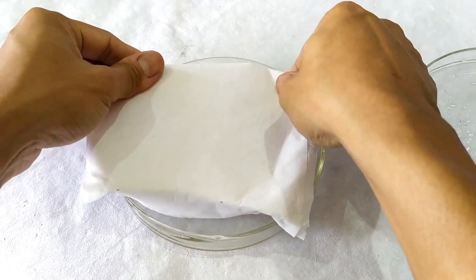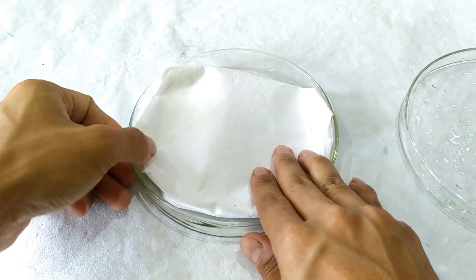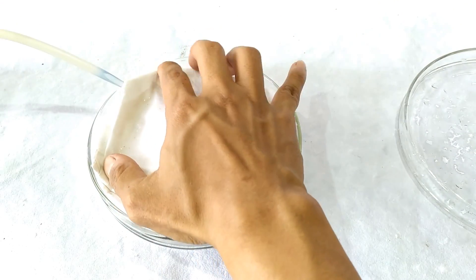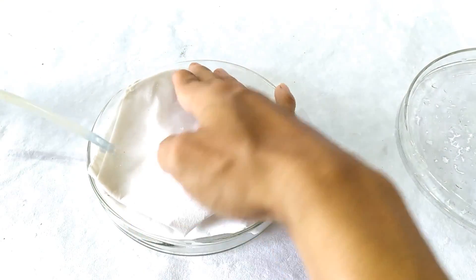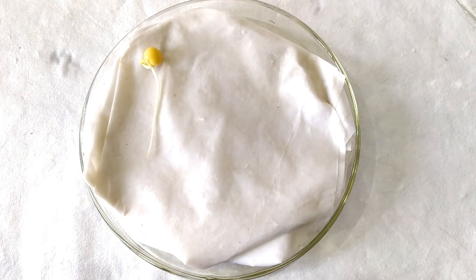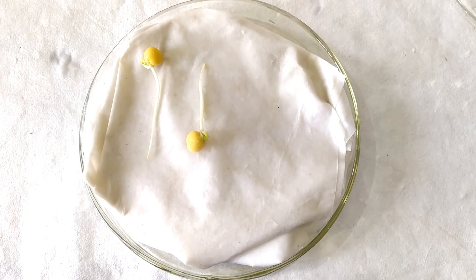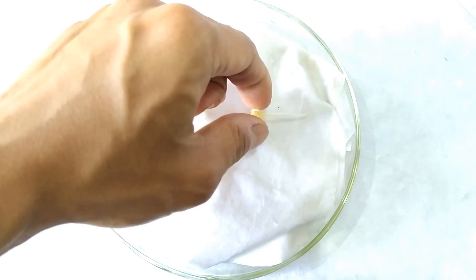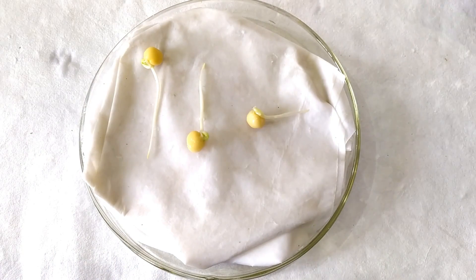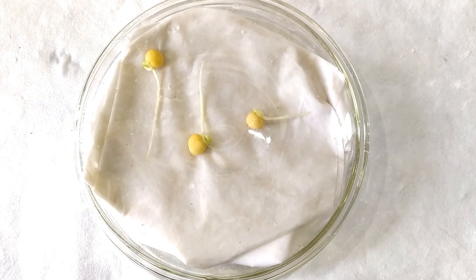Take the petri dish and line the bottom of the plate with filter paper pads. Wet the filter paper by adding some water. Take three germinating seeds with straight roots and place them on the filter paper pad such that one seed has its root facing downwards, one seed with its root facing upwards, and the third seed has its root facing sideways. Cover the petri plate with its lid, adjusting the thickness of the filter paper pad so that when covered, the seeds are pressed by the lid against the pad and remain in position.